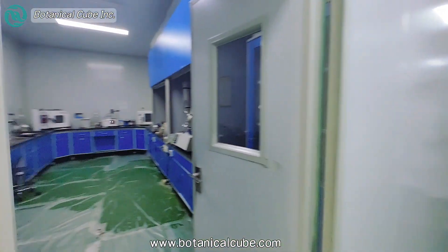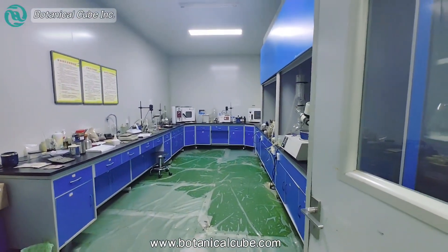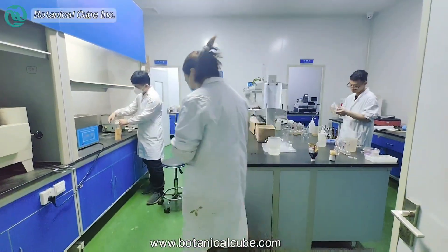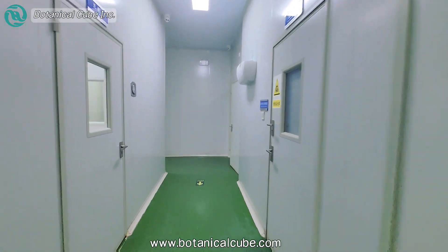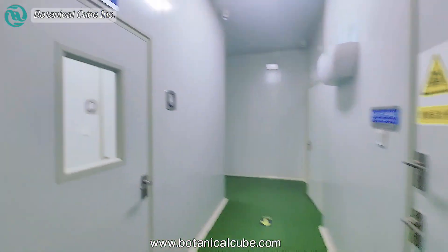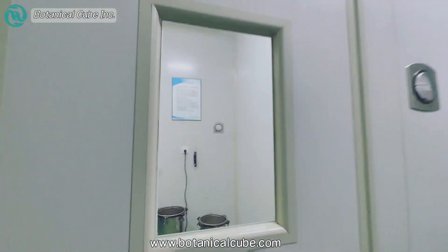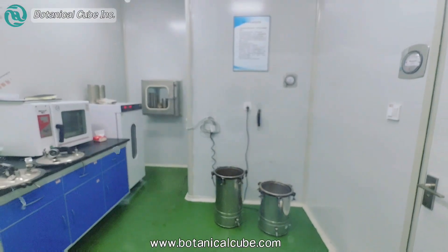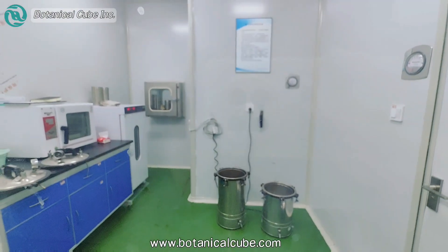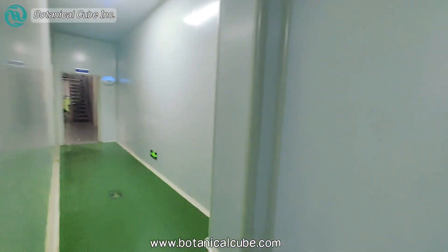Here is the room of the R&D department, and this is another one. This is their room for microorganism testing. Not all factories can have this room.